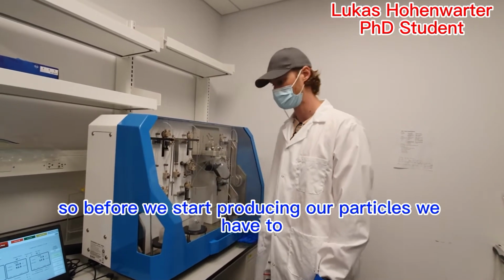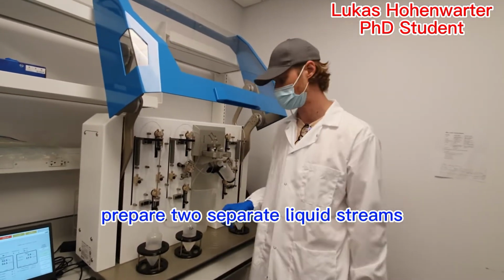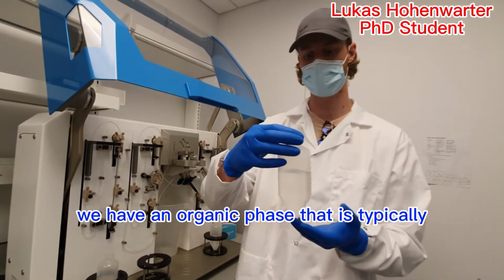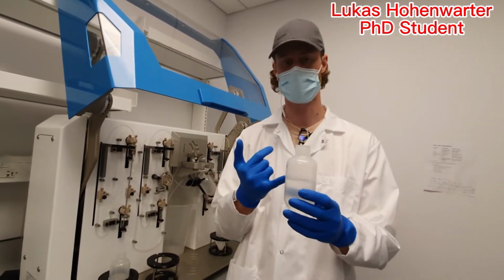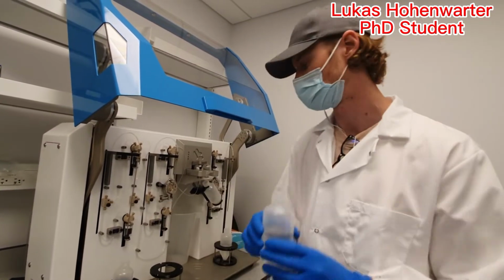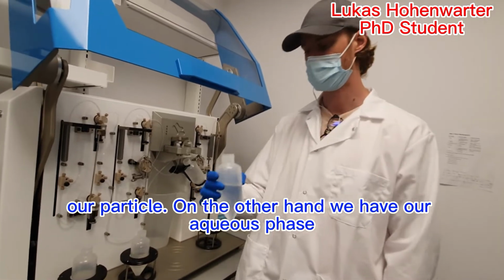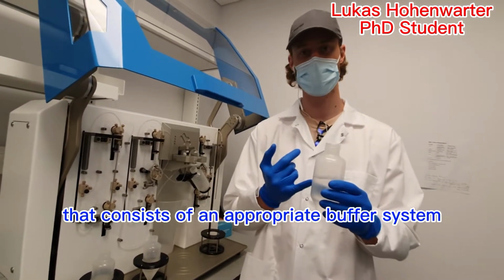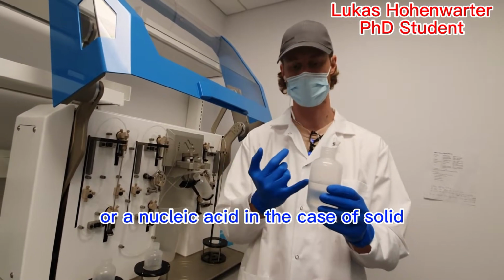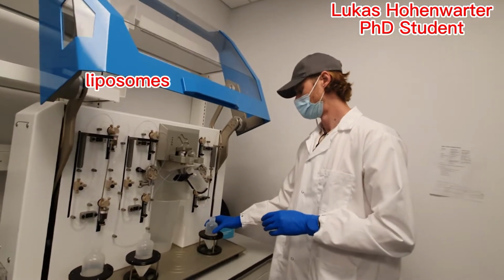Before we start producing our particles, we have to prepare two separate liquid streams. On the one side, we have an organic phase that is typically an organic solvent that contains our lipids that will eventually make up our particle. On the other hand, we have our aqueous phase that consists of an appropriate buffer system and may sometimes contain a drug or a nucleic acid, in the case of solid lipid nanoparticles, for example.